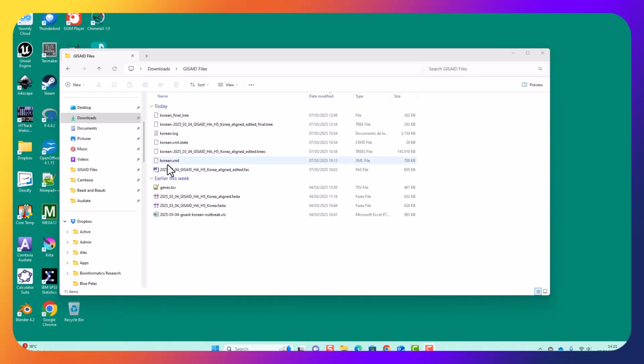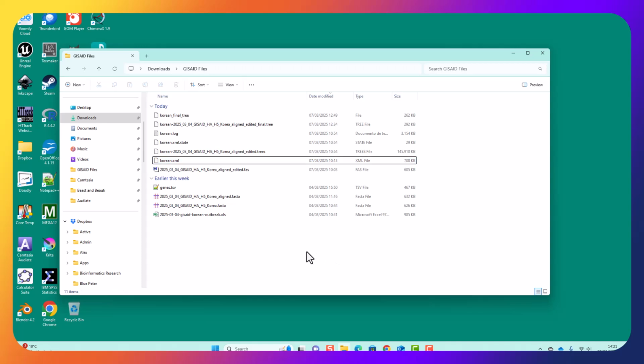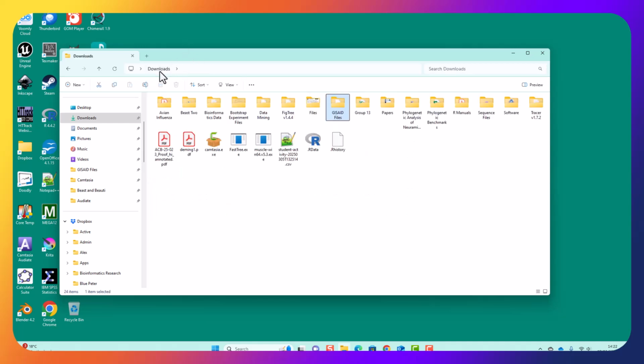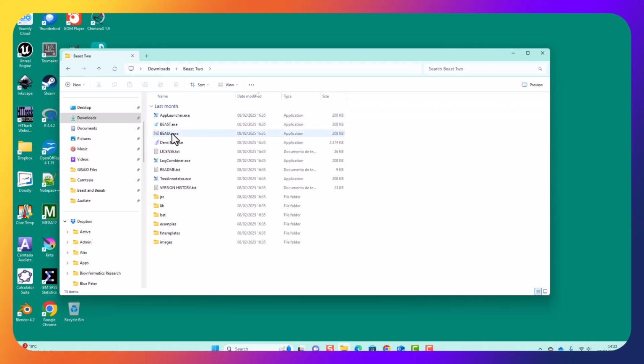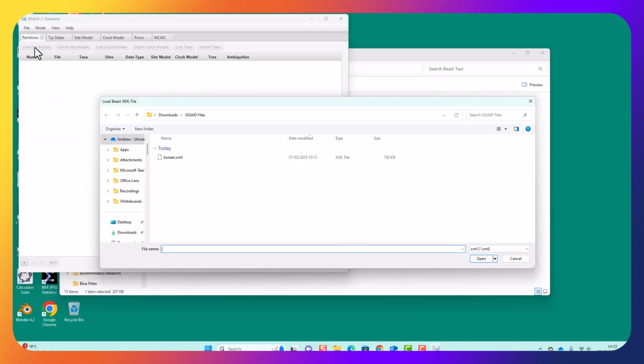Okay, so the original model didn't work very well, so what we need to do is edit it to change it so that first it's going to run for longer, and second I'm going to change the population model to a fixed population. So I need to open it with BEAUti, the existing file. Now file, load, Korean.xml.